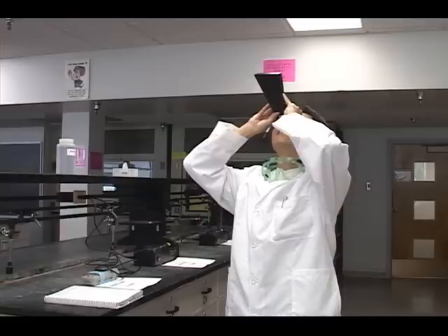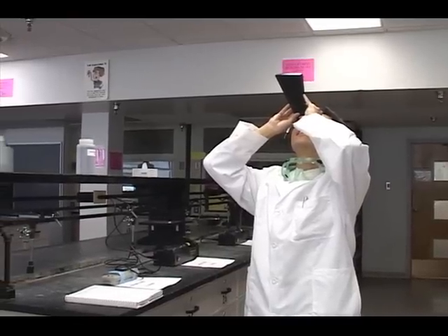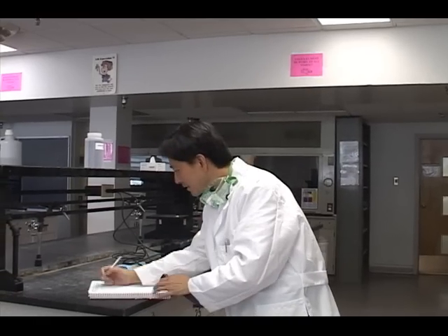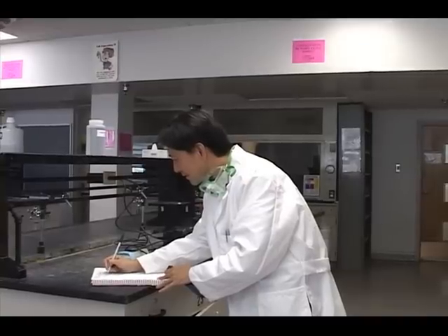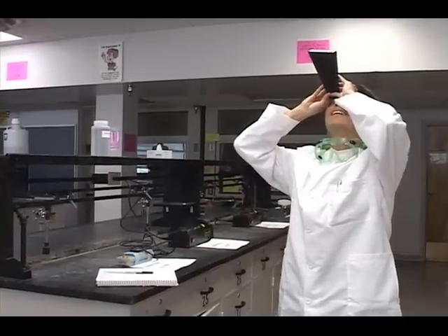To get started, you must first calibrate the spectroscope. To do this, you will examine the fluorescent lights in the lab and record the emission line spectrum details. Then, using the equations and tables found in your lab notebook, you will determine how far off your particular spectroscope is. If you switch scopes during the lab, you must recalibrate.